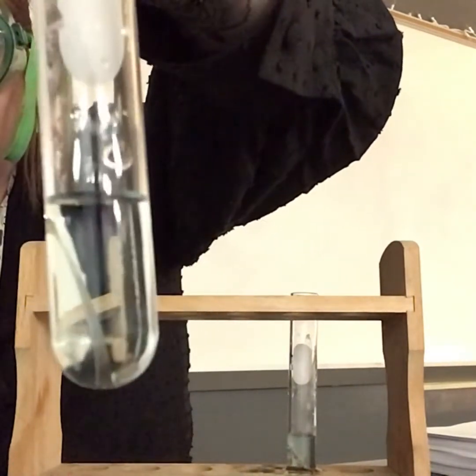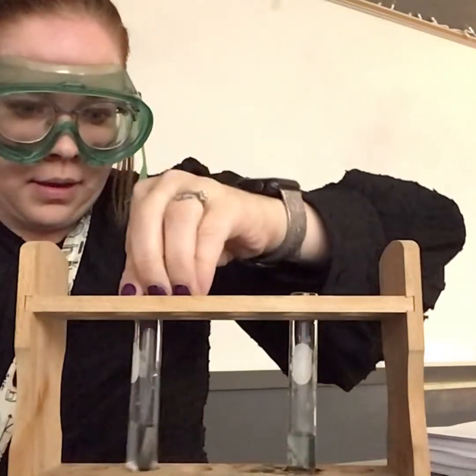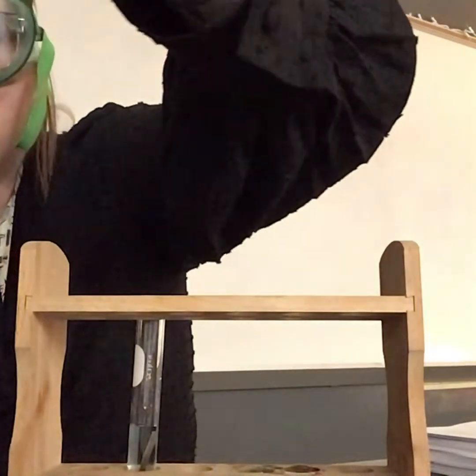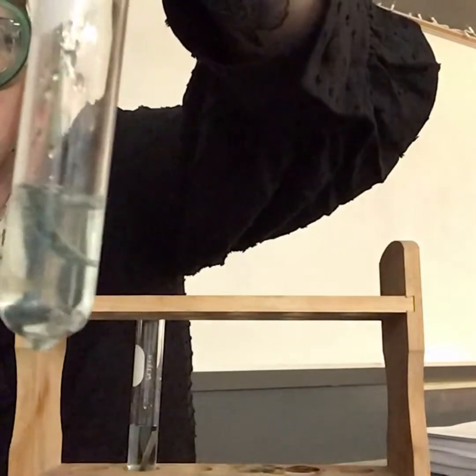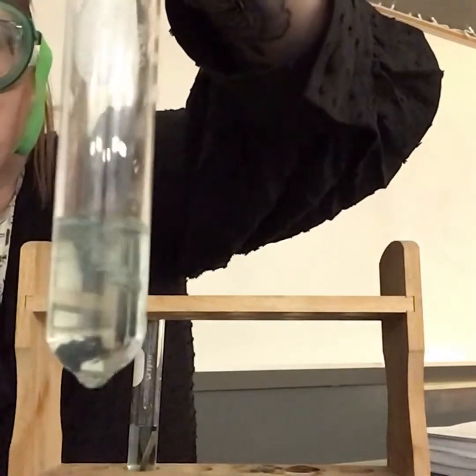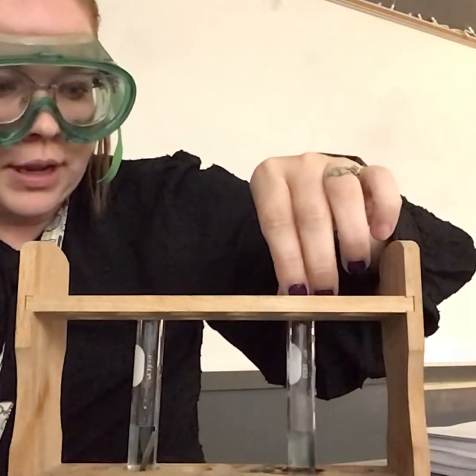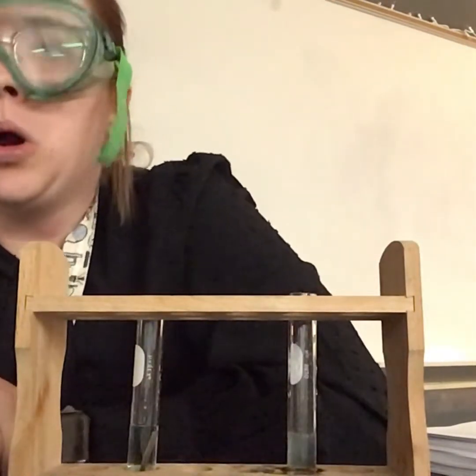Nothing's really happening - no bubbles, nothing. Okay, so here's the magnesium reaction again. It is covered in bubbles right now. I'm going to give that a little bit and I will post a picture of what that looks like when the reaction is done.